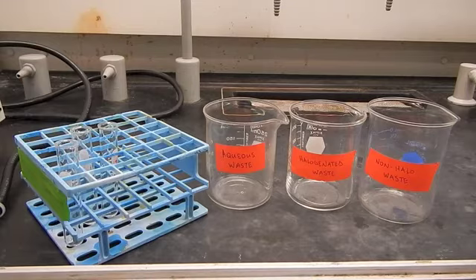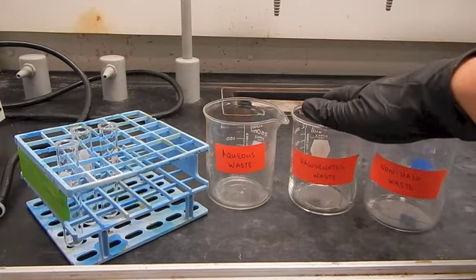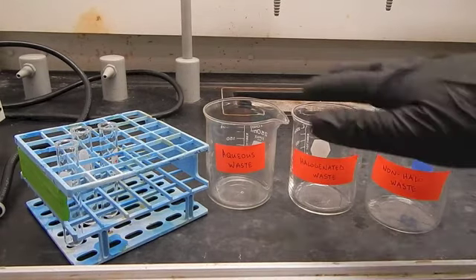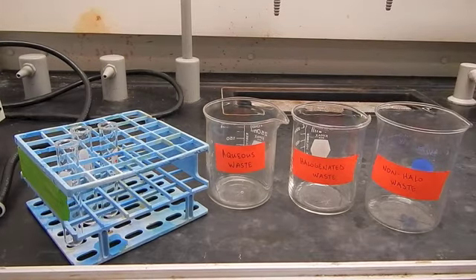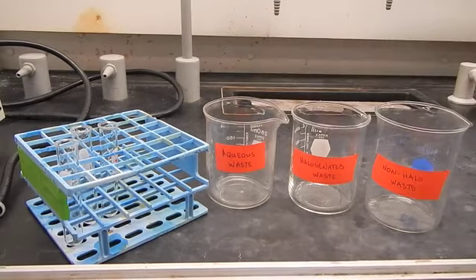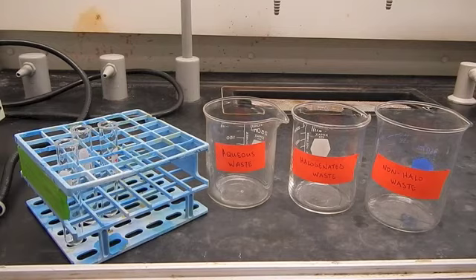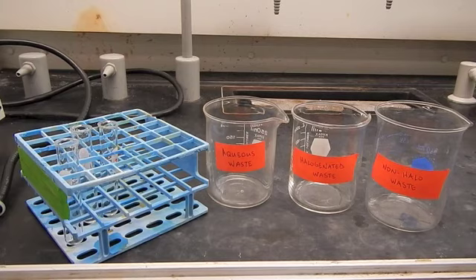You'll also notice that I've labeled 2 other waste jars, halogenated waste and non-halogenated waste, and you can keep these in your hoods and just use them throughout the day, collecting your waste in the appropriate waste jug, and then at the end of the class you can just take 1 jug over. That'll really save you a lot of time as you move forward, and again will help cut down on that congestion around the waste area.